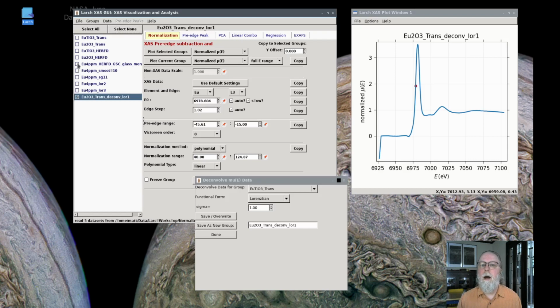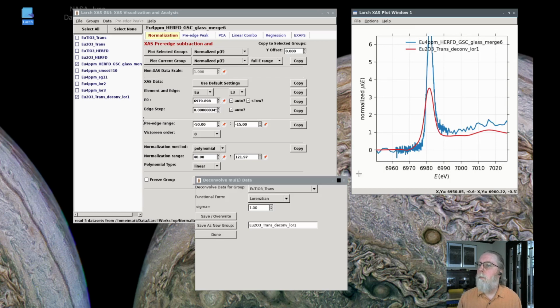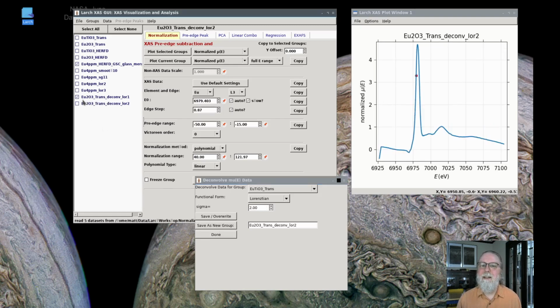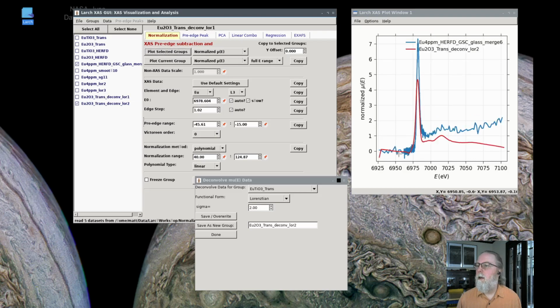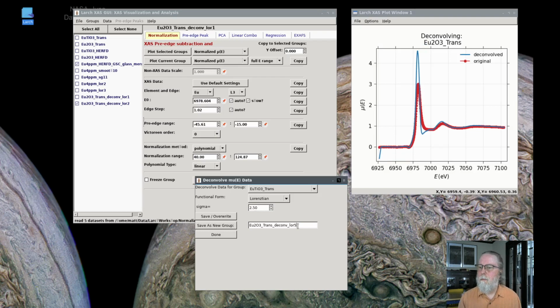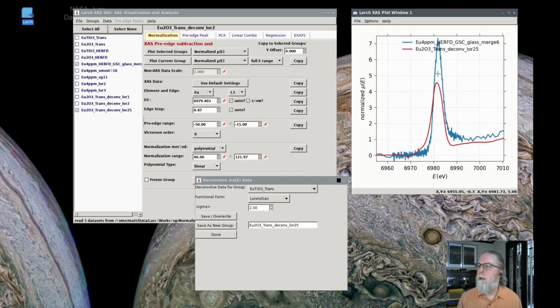Select none, plot that with the HERFD data we have, and you'll see that that's still too broad, so I need to deconvolve it more than that. At 2 eV, that looks more sharp. I'm going to save that, plot those together, and you can see that's still too broad. If I continue to 2.5, save that, it's still too broad, and we're not reproducing the main peak correctly, and it looks like we're introducing a shift.